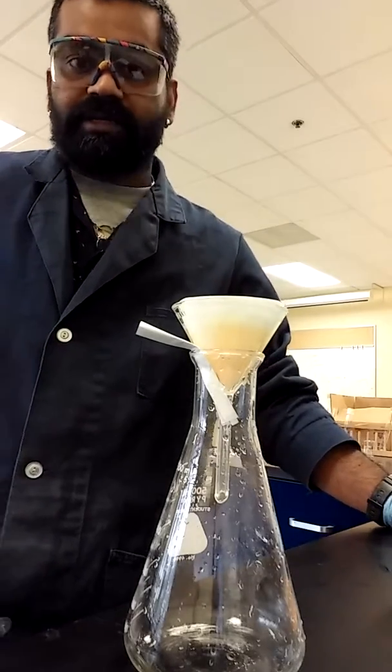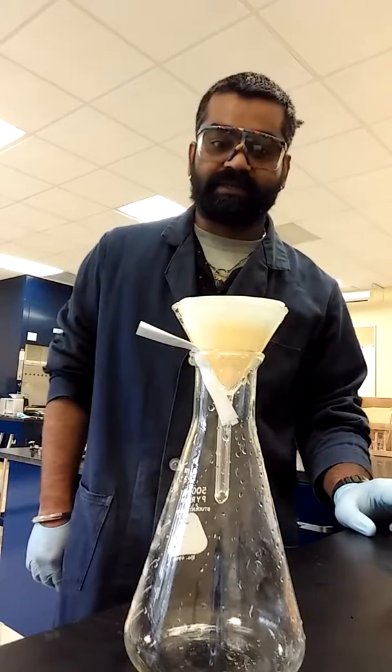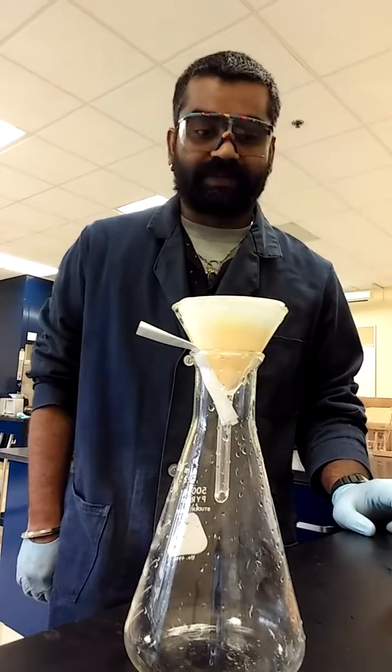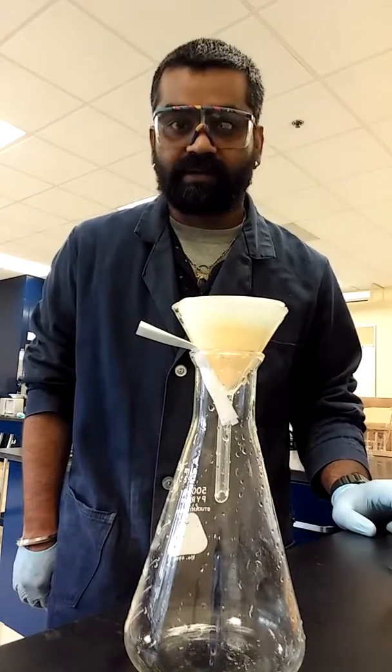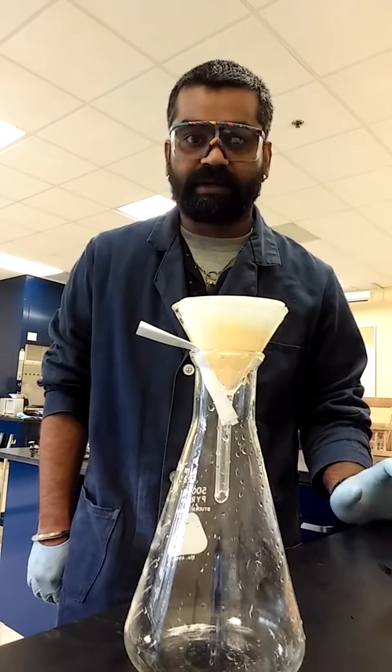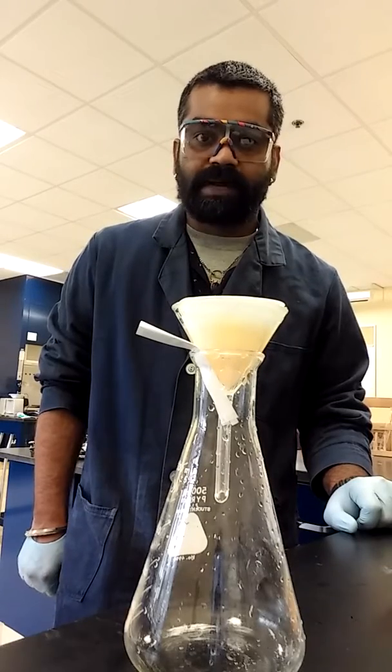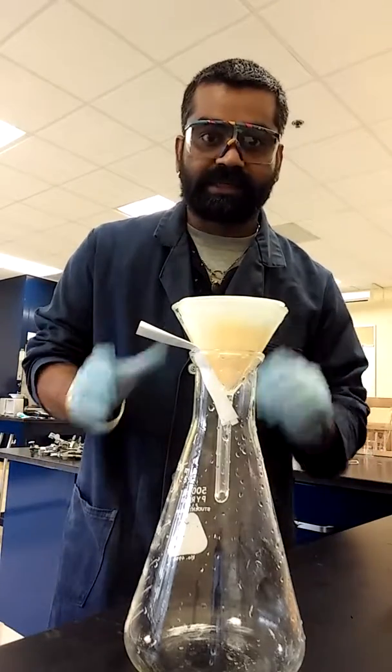But in the future, I'll see if I can get some time-lapse shots and it will be cool. But for citric acid synthesis, we don't require that much coolness. So I'm going to cut off the video here and I'll see you back when I'm ready with step three.